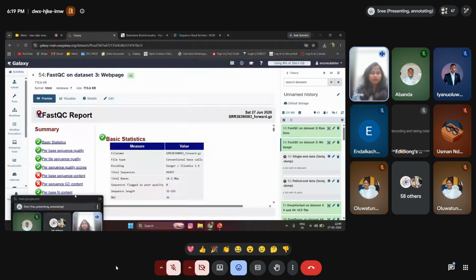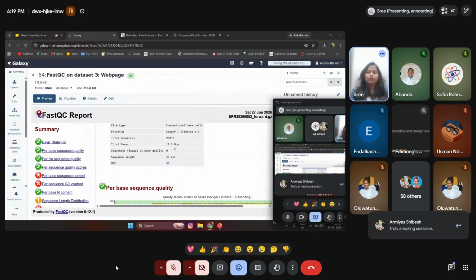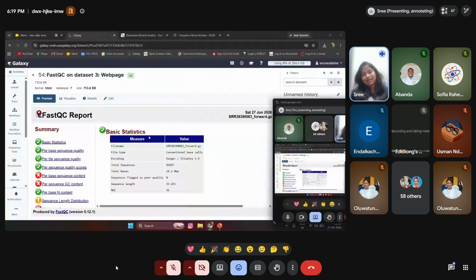You can see the entire results. I'm going to explain it step by step in a little more detail. You can see the information of the report, which has basic statistics, telling about what the file format is, what the file name is, how it is encoded, what the total sequence length is, what type of sequencing takes place, what the total bases are, how the sequencing flags, whether it is good quality or bad quality, what the percentage of GC content is. All those information it has. And you can have color changes.